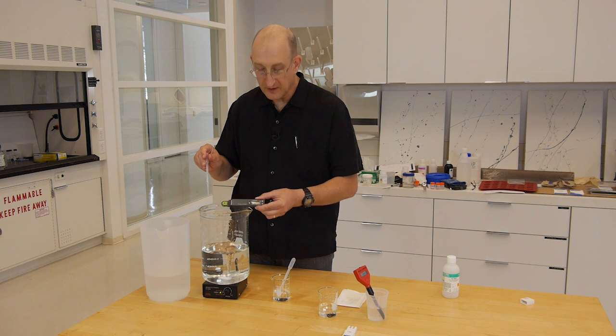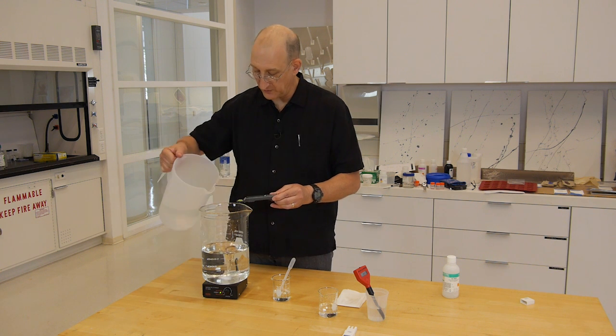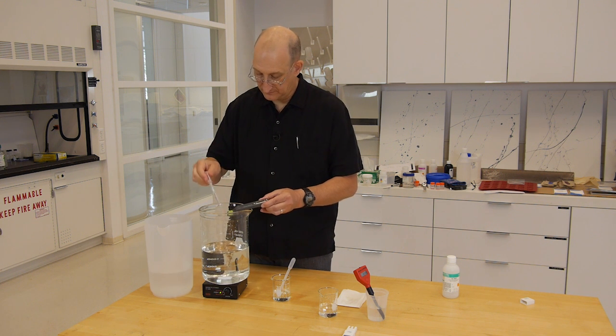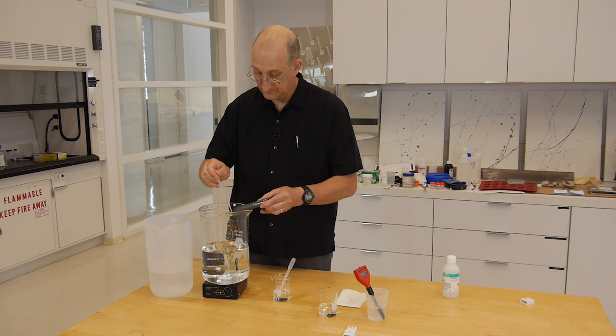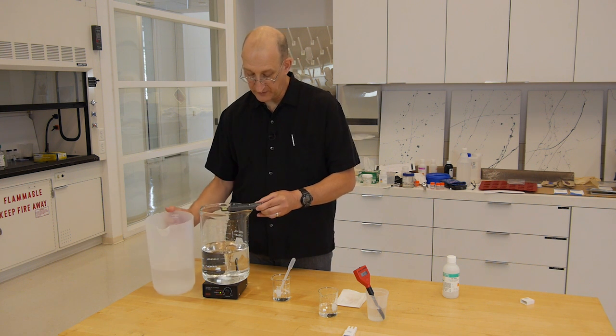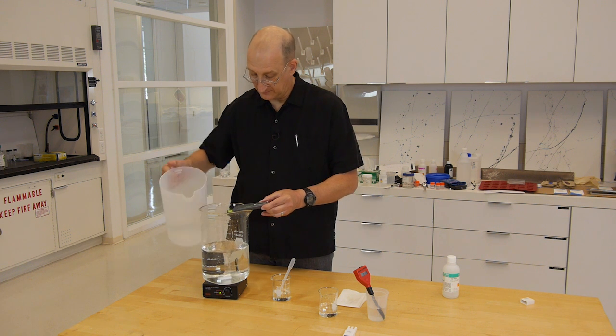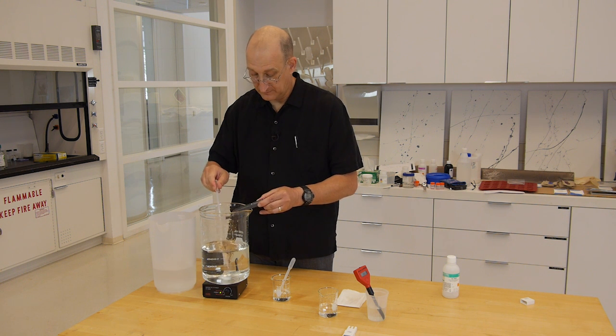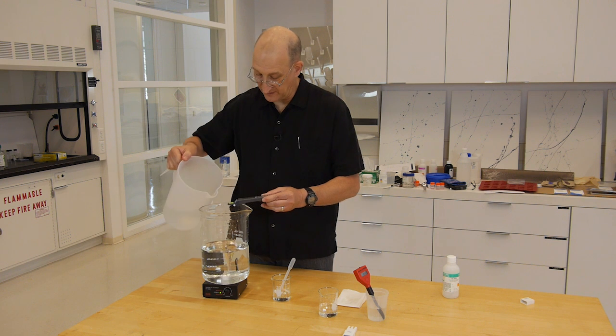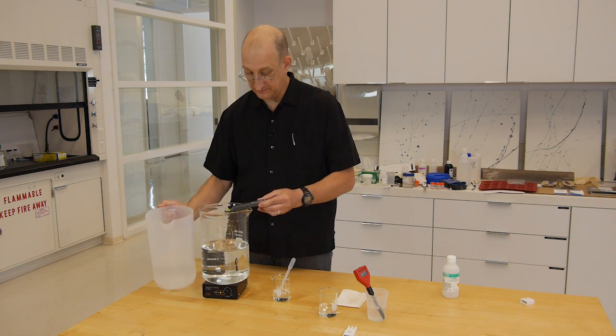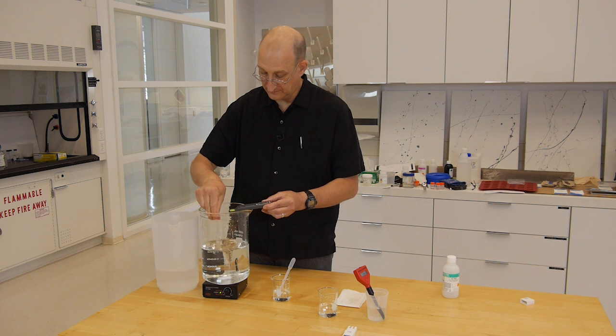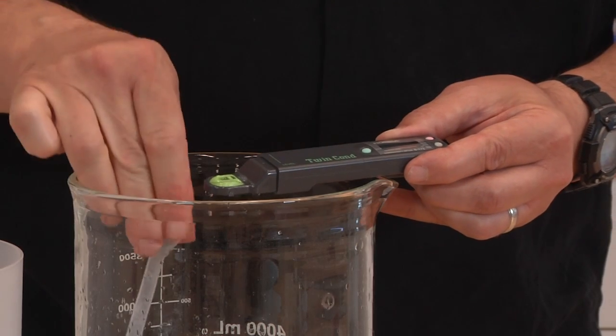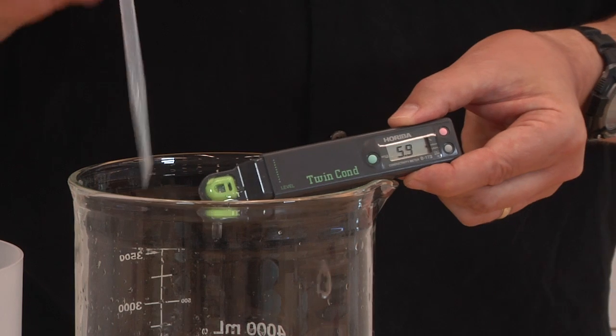Now that it's stirred a little bit more, we're at 6.4. Add a little bit more. 6.3, 6.3, 6.2, 5.9.